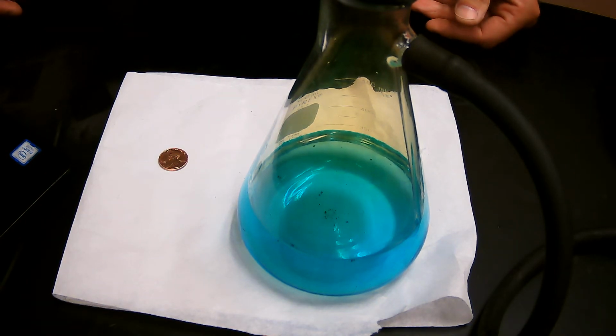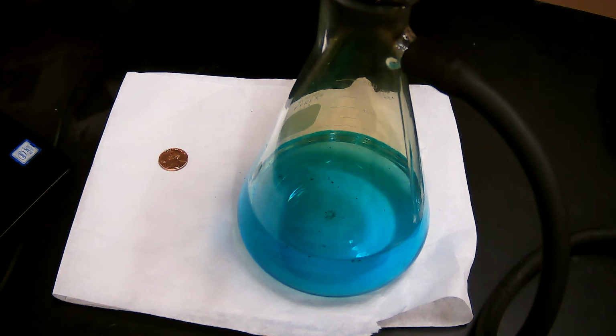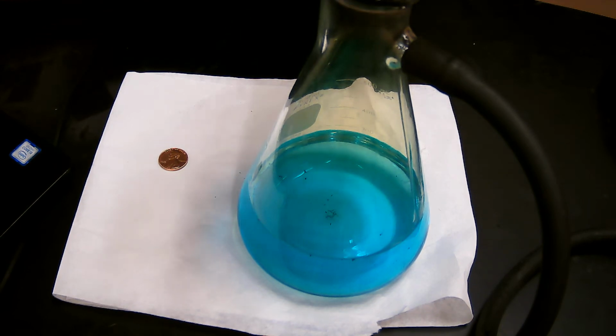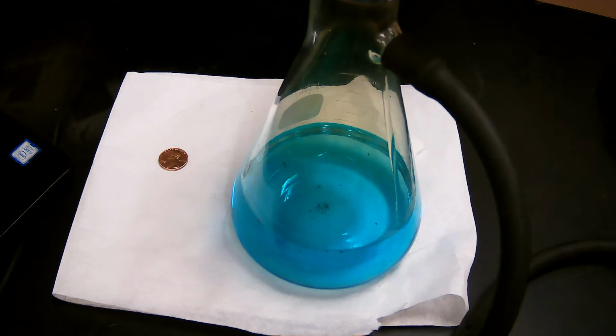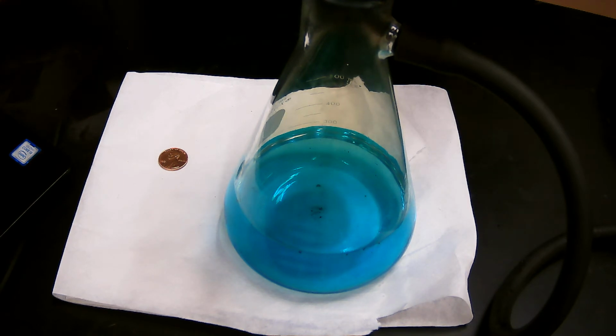So if we think about this very costly experiment for Mr. Remsen, we can think of two things. One, we never ever want to just haphazardly mix chemicals together in the lab. And secondly, when we go to communicate what our experience was in the lab, we need to make sure we measure our words. Had Ira Remsen read nitric acid acts upon copper, releasing a gas that is toxic, irritant to the lungs and eyes, it creates a lot of heat, and the acid is very, very irritating to the skin, he probably wouldn't have done it at the doctor's office. Probably still would have done it, probably at the college, in a fume hood, where he could just watch it in safety.